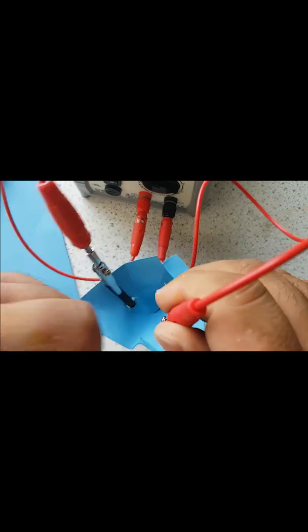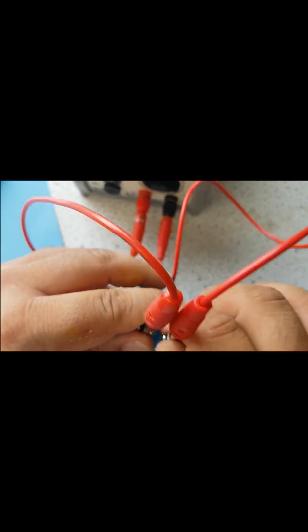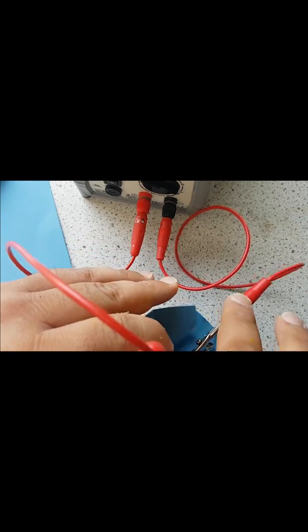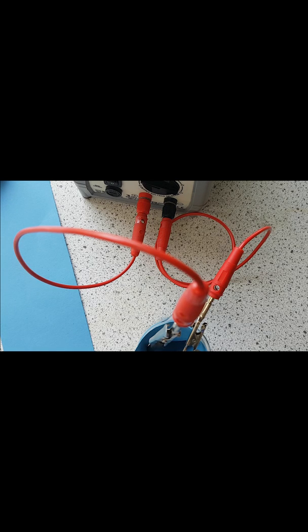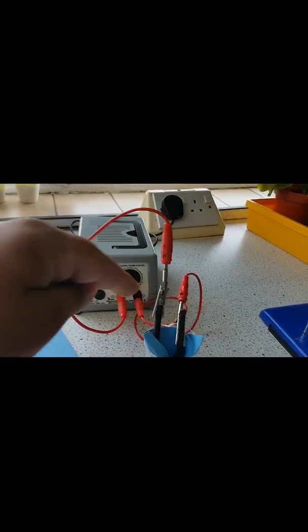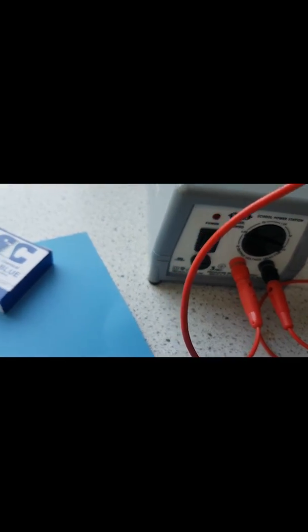Ram the card in as much as you need — the more you do the better. The electrodes should now be well separated. Remember the positive and negative wires: the positive wire connects to one carbon rod giving it a positive charge, and the other rod has a negative charge. Set the power pack to 4.5 volts, switch it on, and make observations.